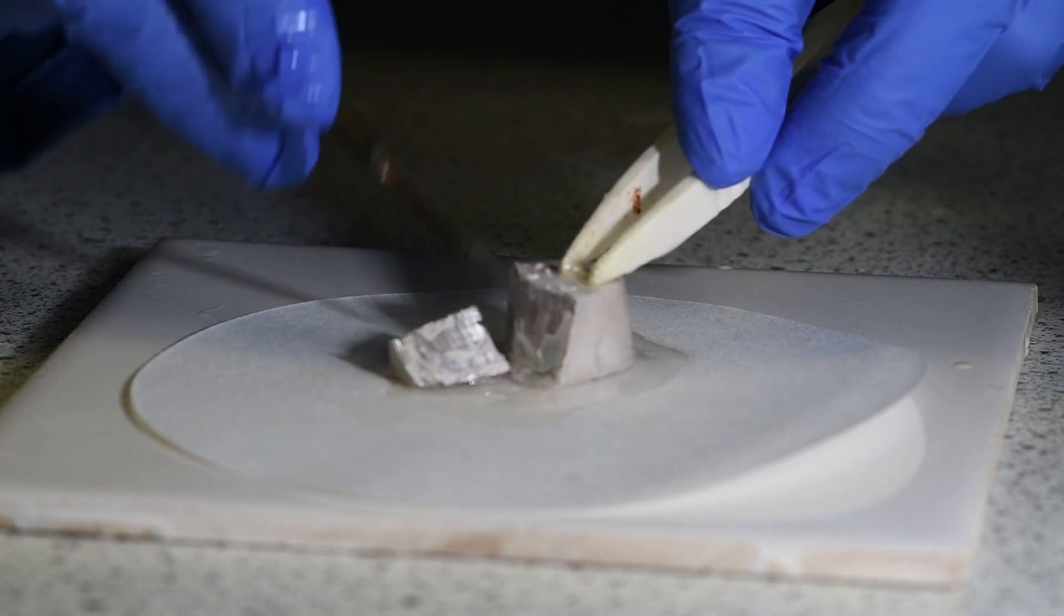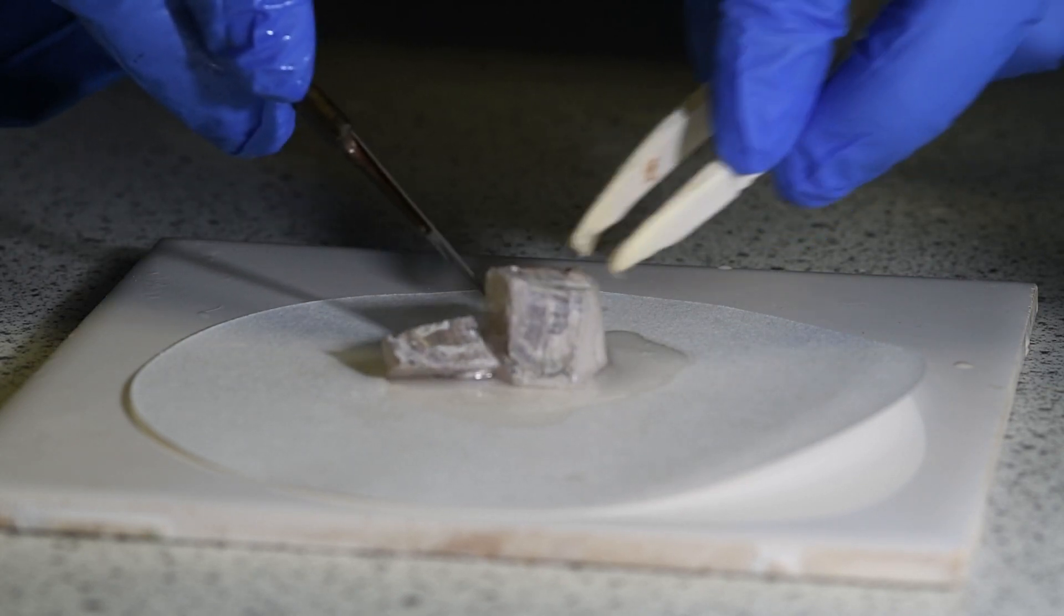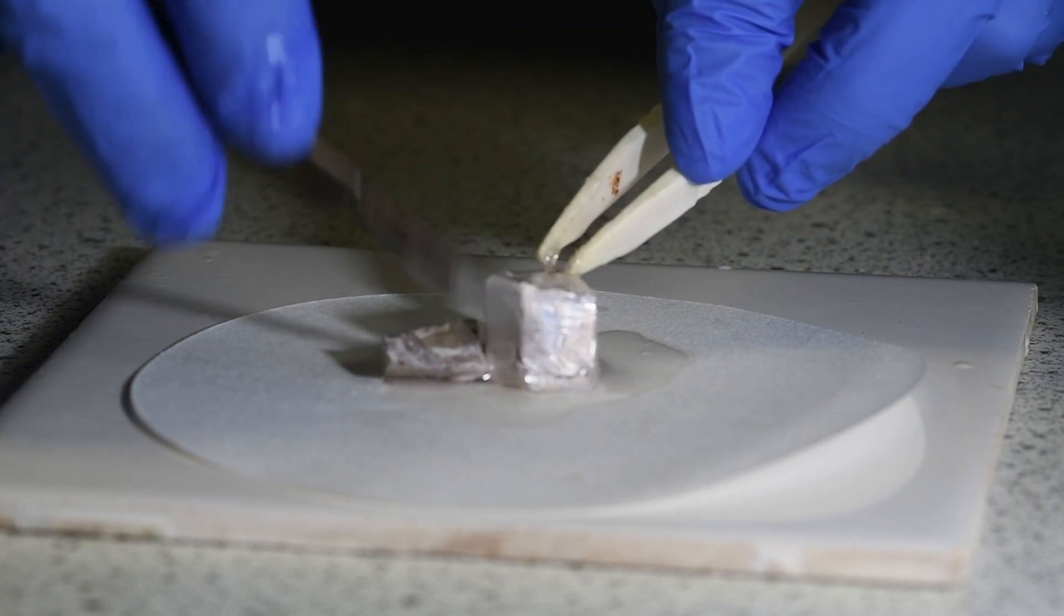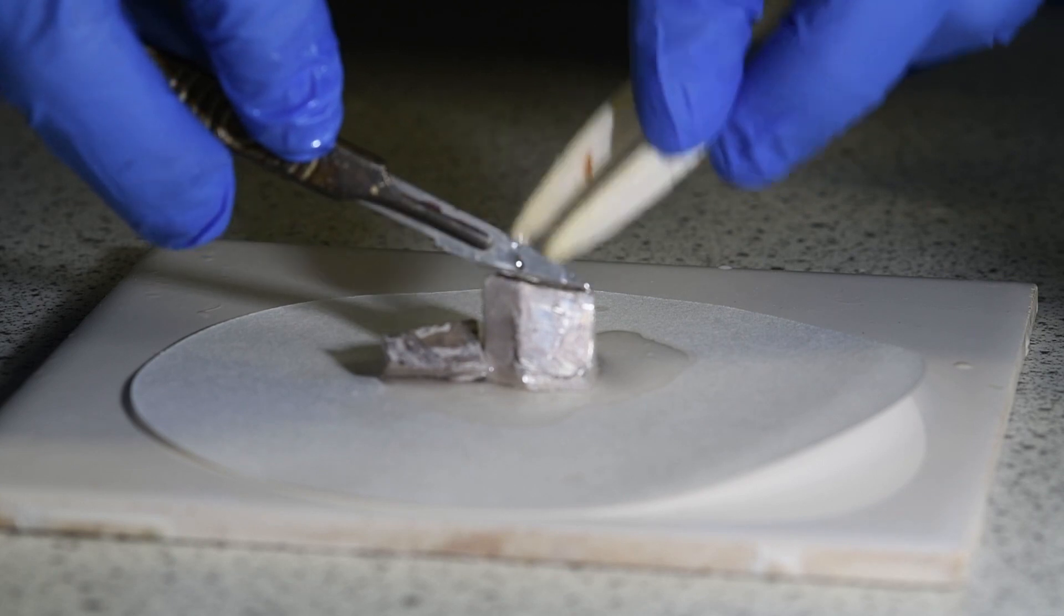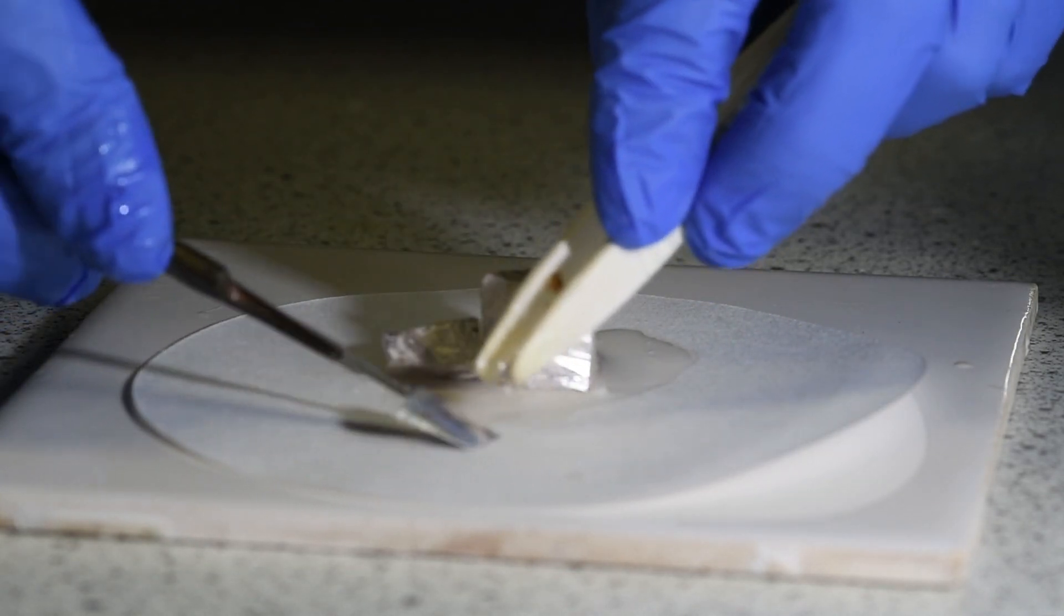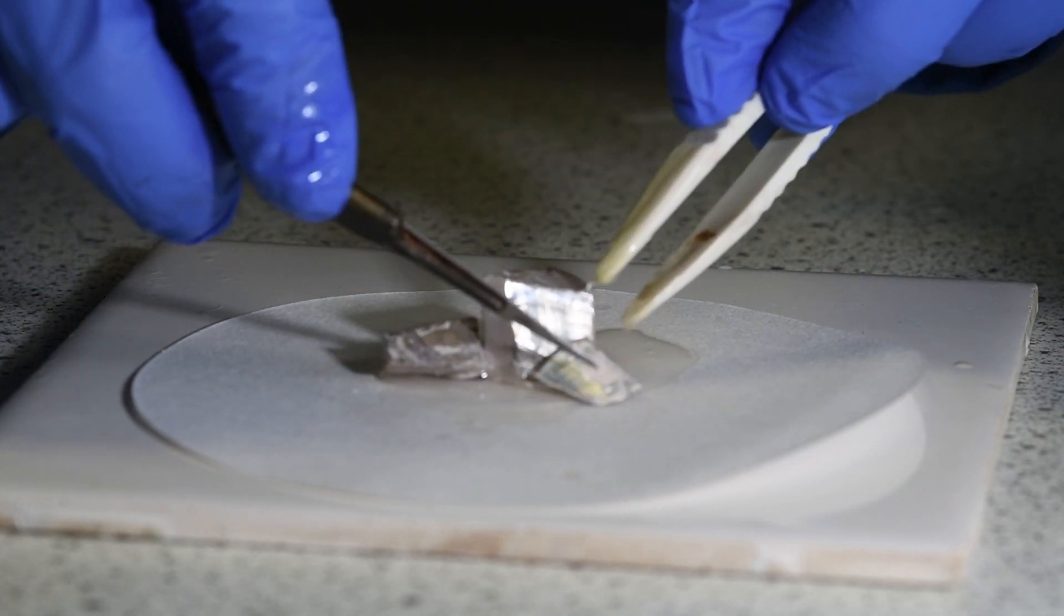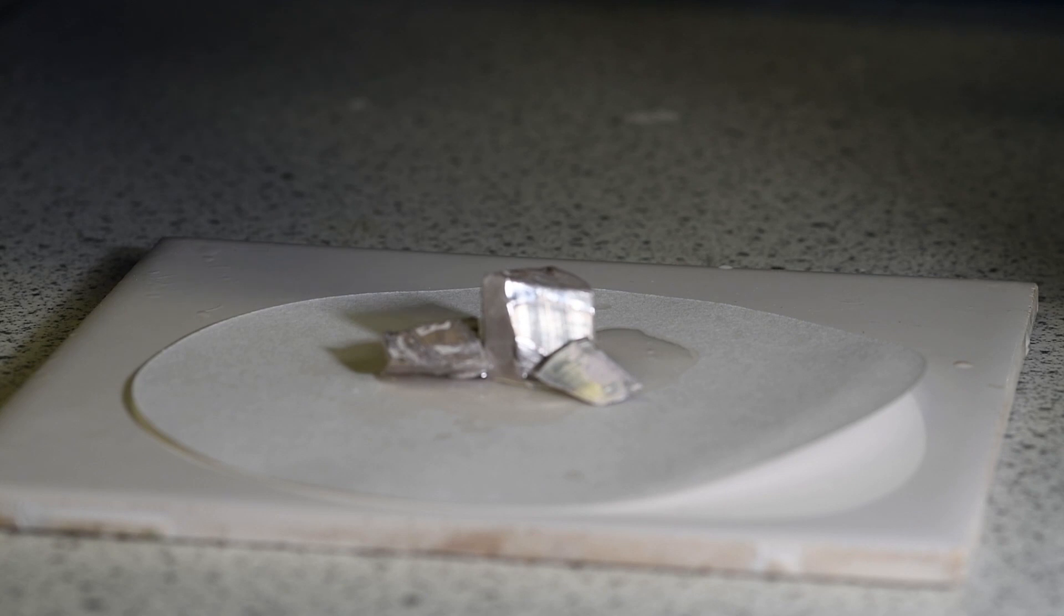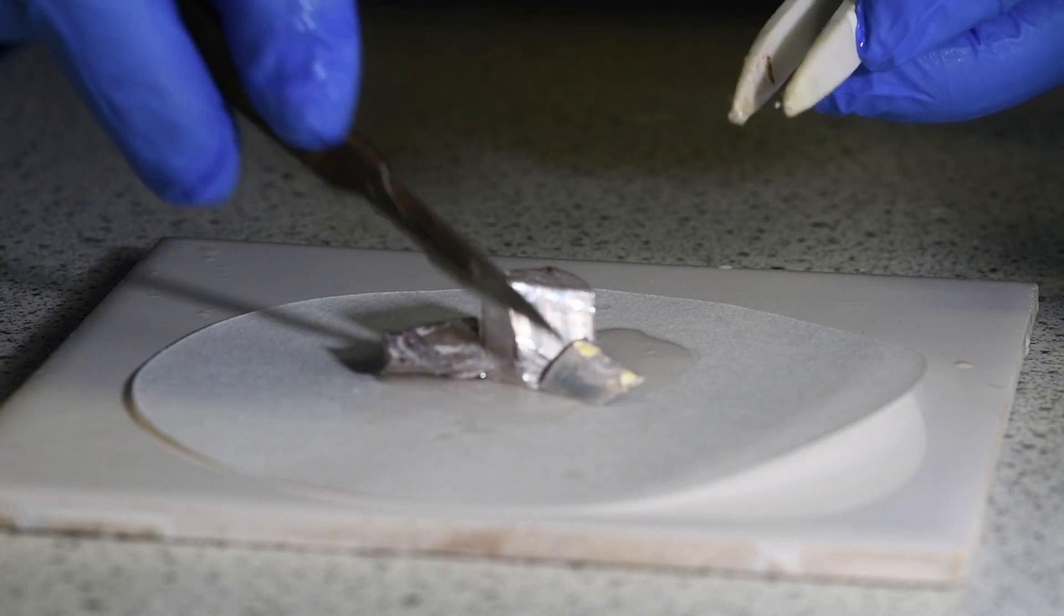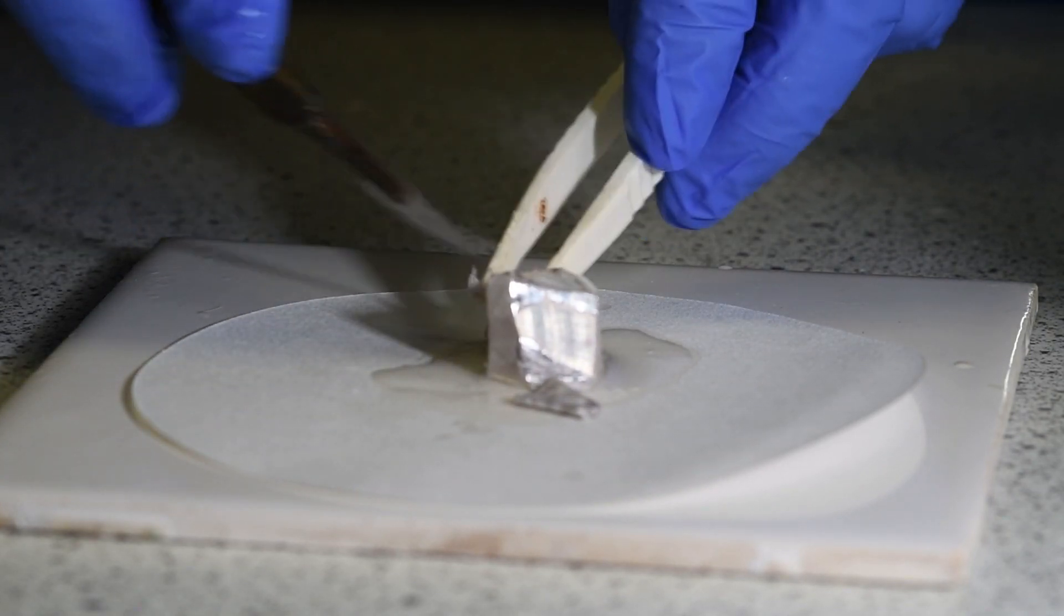So where it was nice and shiny, it very quickly becomes dull. Let me just cut another piece off there. So you can see it was very shiny and already it's gone very dull. So that's sodium, a bit more reactive than the lithium.